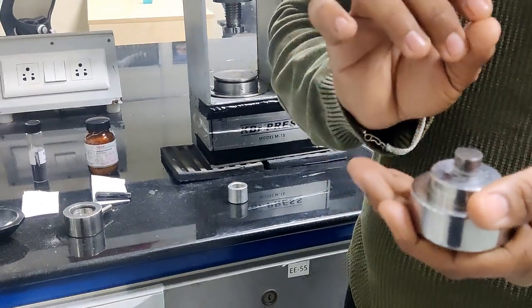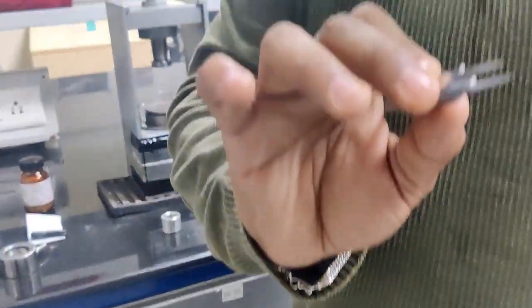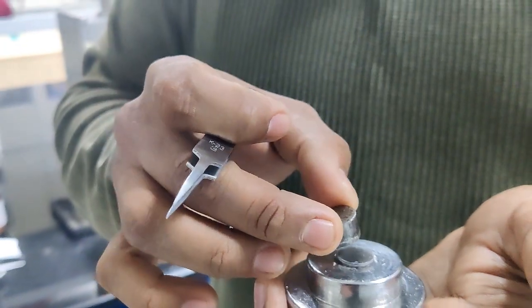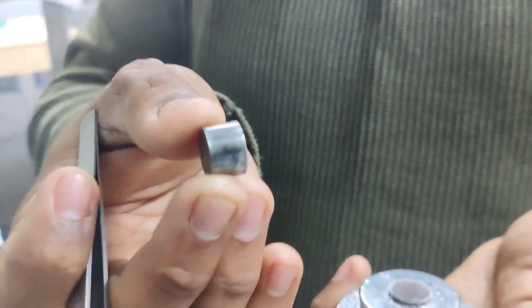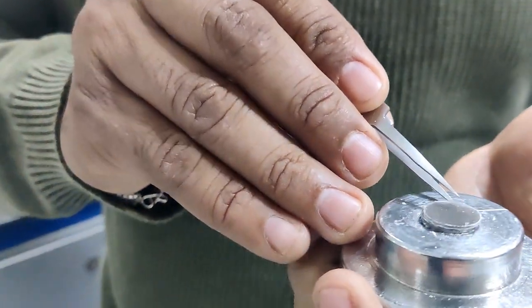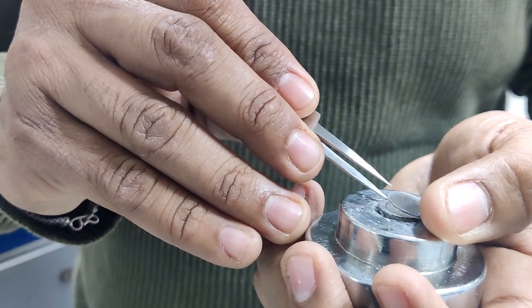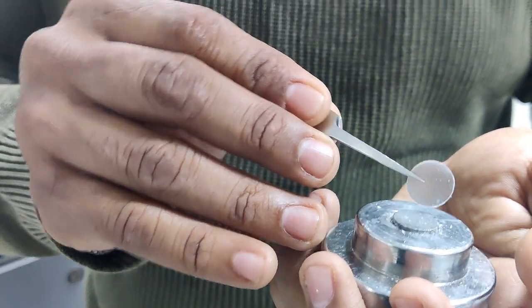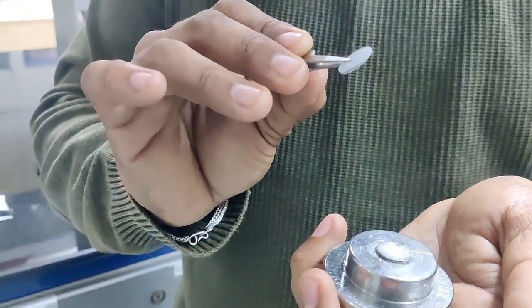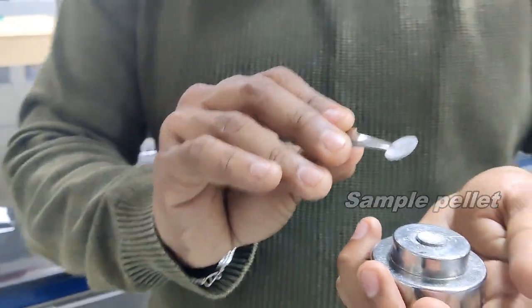For handling this pellet we have to use forceps. Take out this lower plunger. So I am just taking out this one. With the help of forceps you have to hold the pellet. We have to be careful while holding the pellet. So this is the sample pellet, the prepared sample pellet.